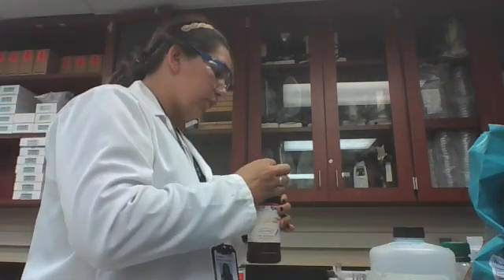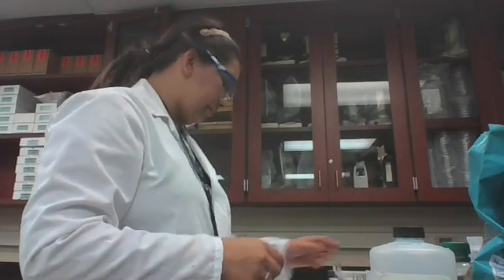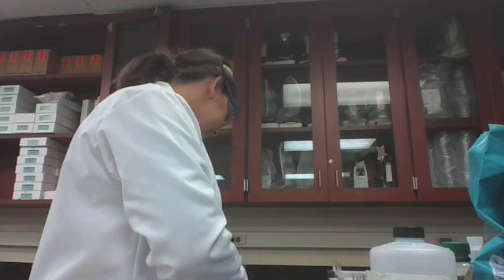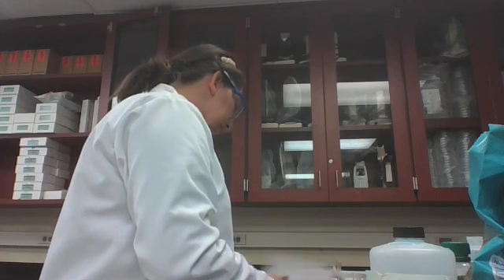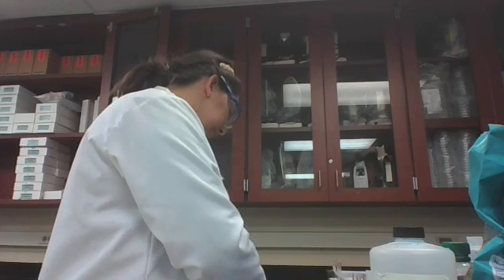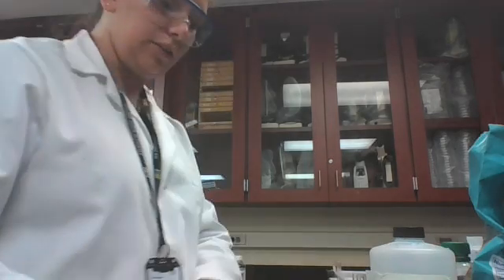Our last one is cornstarch. That's a complex carbohydrate. We're going to be using potassium iodide. So, is it? Hopefully you're marking these down as we go. Simple sugar, complex sugar, Lugol's iodine solution. So 3 to 4 drops of iodine solution in this one.